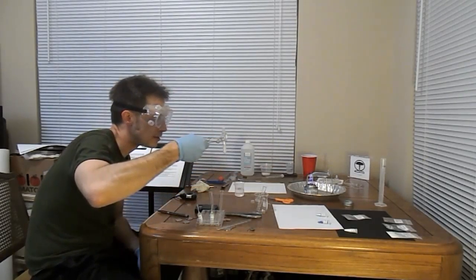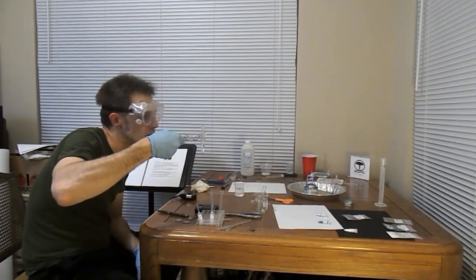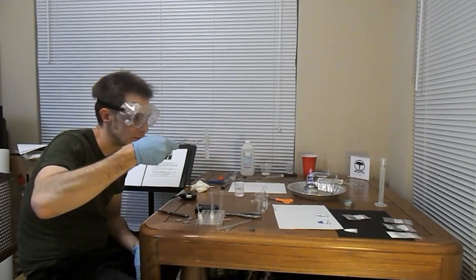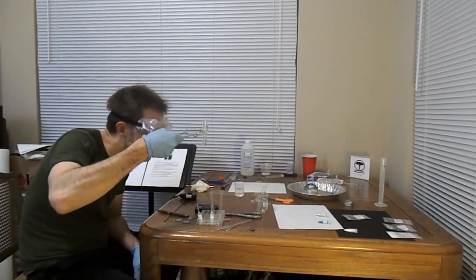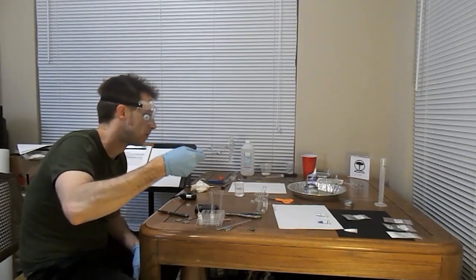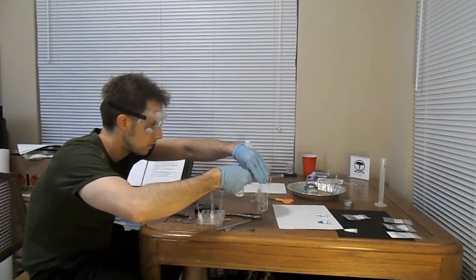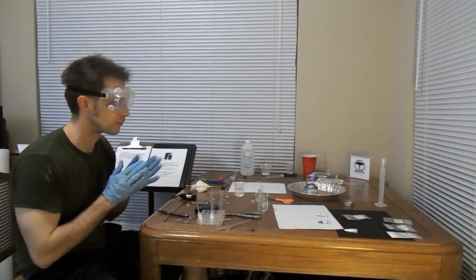Yeah, we got it to boil, and the only change I see now is the magnesium is now on the bottom of the test tube instead of floating on the meniscus, which was more likely caused by the size of the sample particles than by any sort of buoyancy. Probably. I'm not an expert. Alright, so that is magnesium tube number 2.